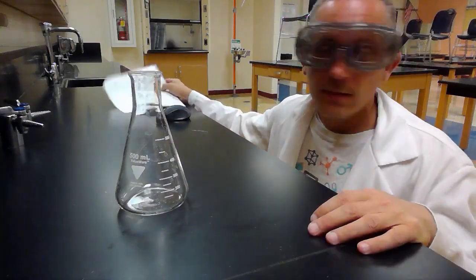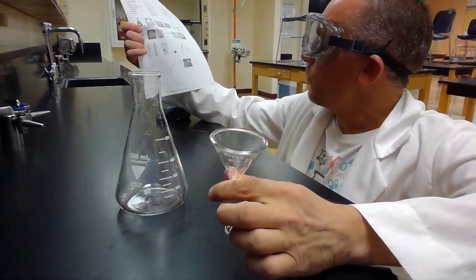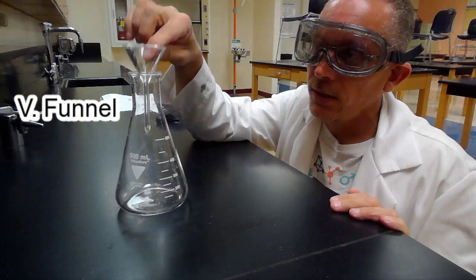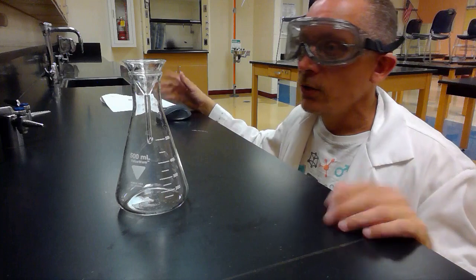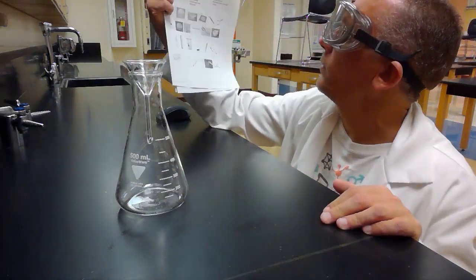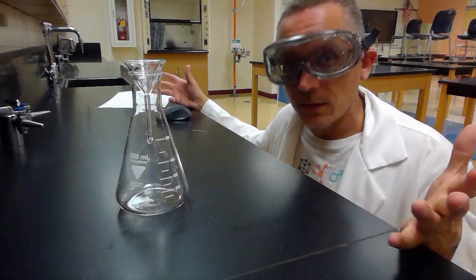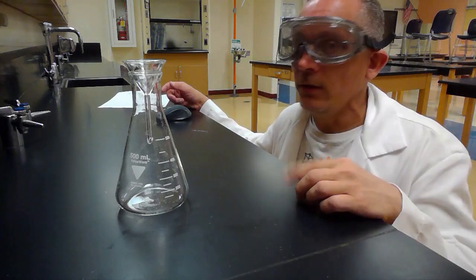The other thing that we can do with this is to use this piece of equipment, which is Picture V. Picture V is what's called a funnel. It's a glass funnel, right? And we can put this in the flask and use it to funnel or filter some things. So Picture V, it's called a funnel. What does it call it? A funnel or a glass funnel? I think it calls it a glass funnel. I'll look on there and see. And what is it used for? It's used to either funnel or filter some things. So there is your Erlenmeyer flask, Picture A, and your funnel, Picture V.